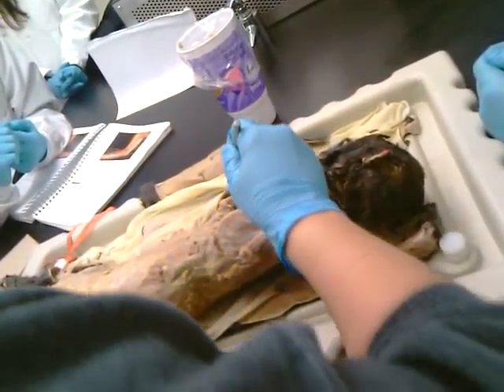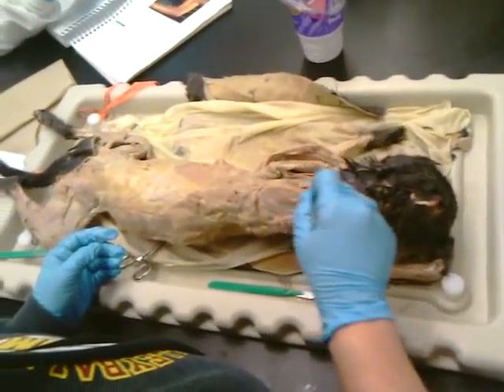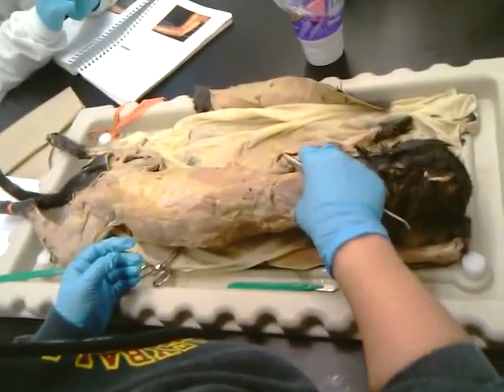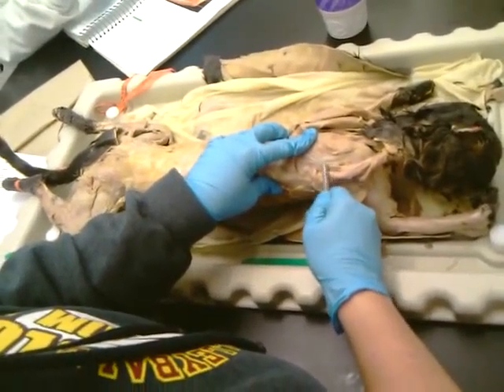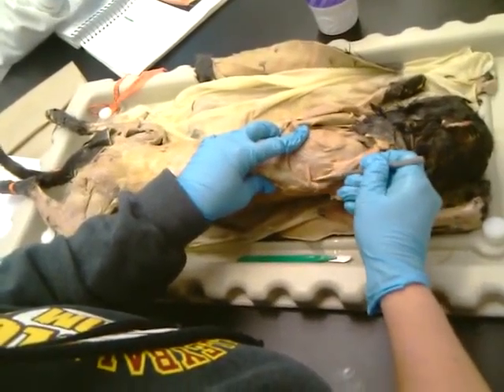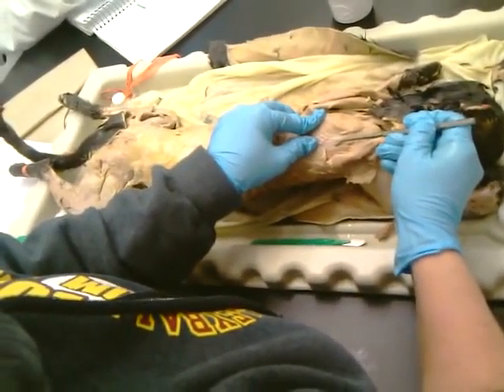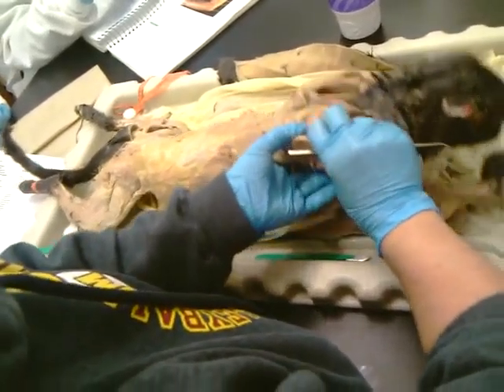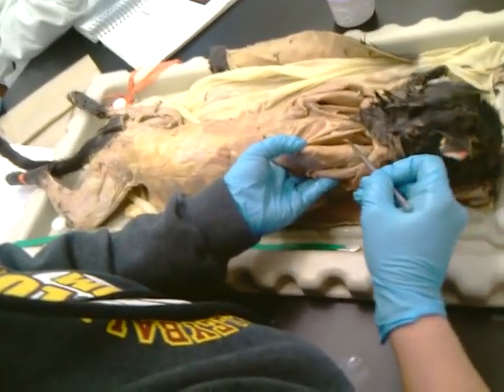Now, I've cut away the trapezius. Okay, so that's out of the way. So here's the muscle that's on top of the spine of the scapula. Supraspinatus. On this side, here's the spine of the scapula right there. It's that little white line. So one's underneath the spine. Infraspinatus. Okay. And then if I go underneath here, subscapularis. Now what's this one?